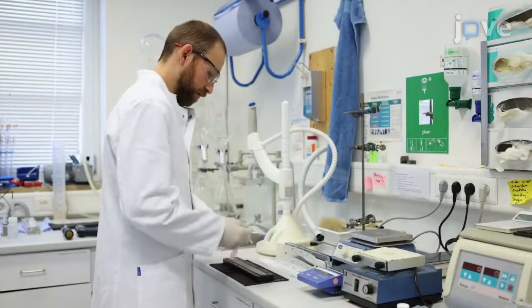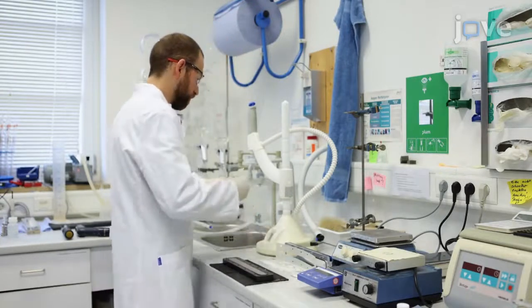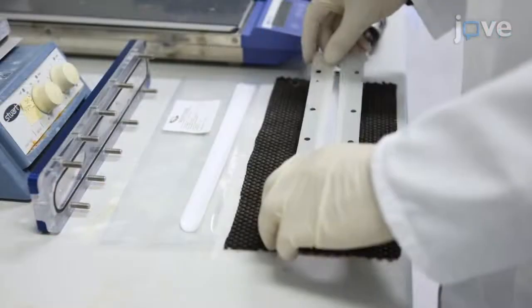After cleaning the system, open the AF4 cartridge to allow replacement of the membrane. Rinse the new membrane with ultrapure water and reassemble the cartridge.